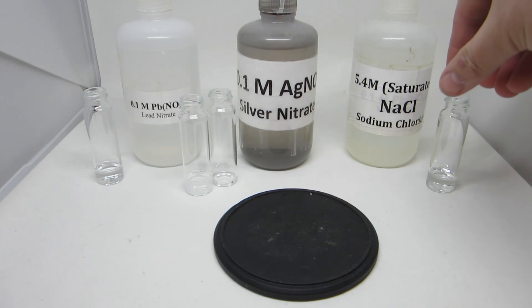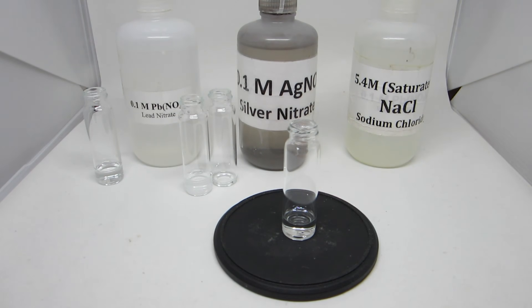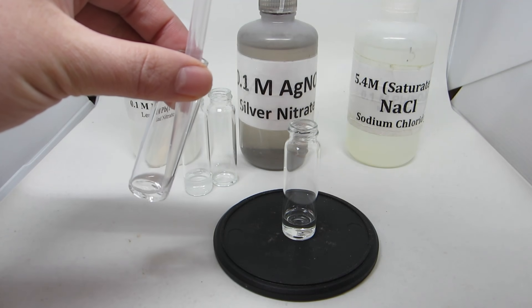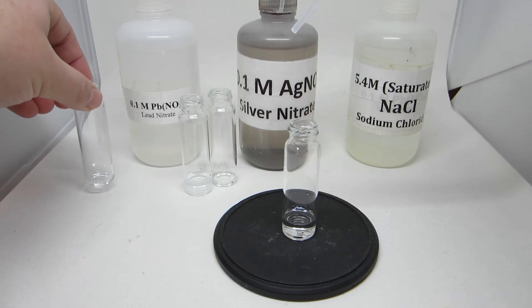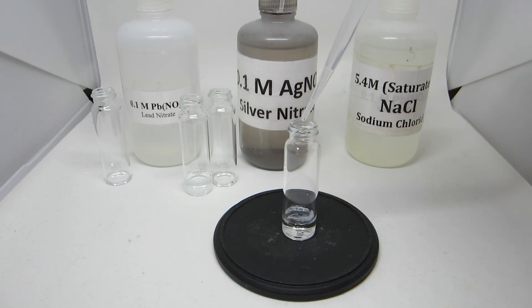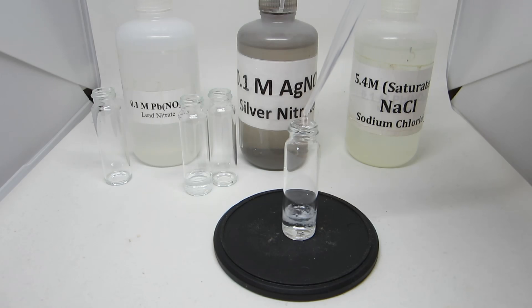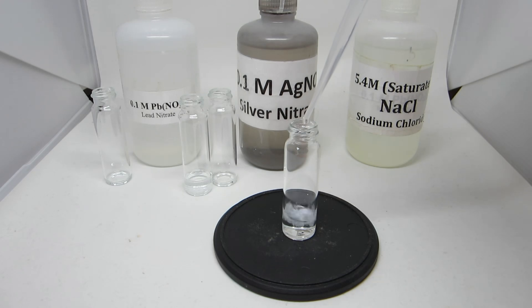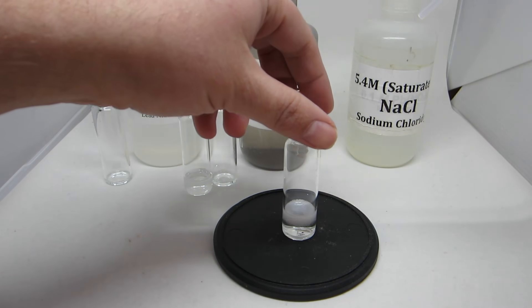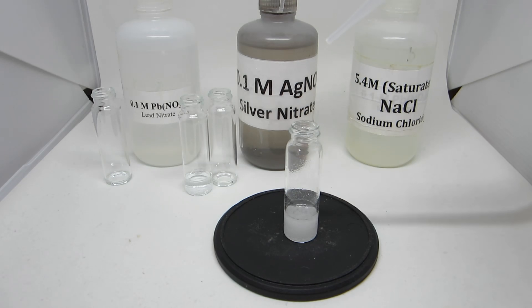When reacting the sodium chloride with lead nitrate, it takes significantly more than one drop before a precipitate forms and remains.